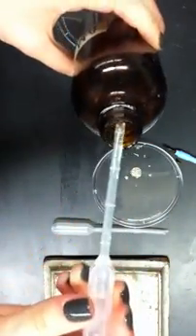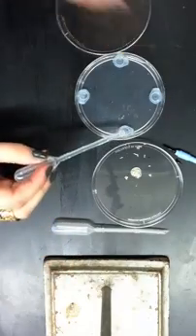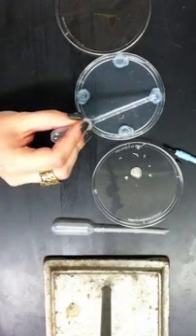And put just enough AM in the Eppendorf tops to fill the holes.